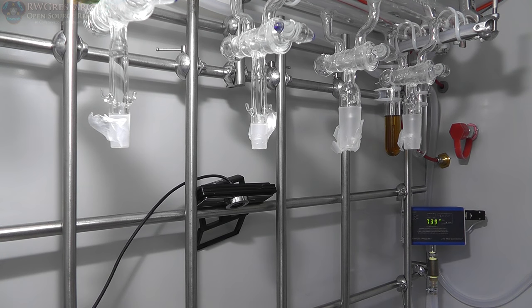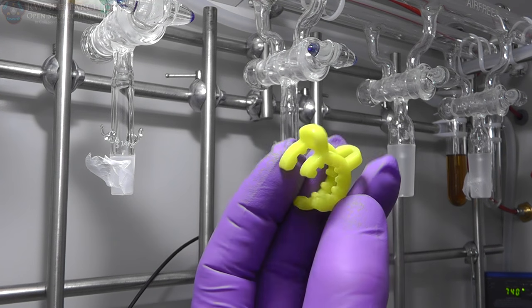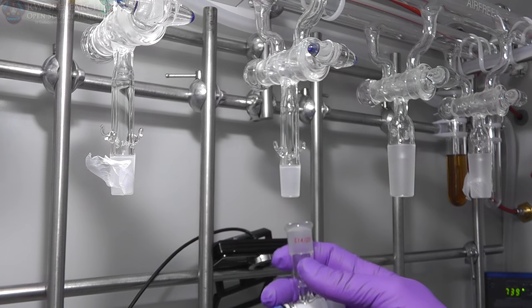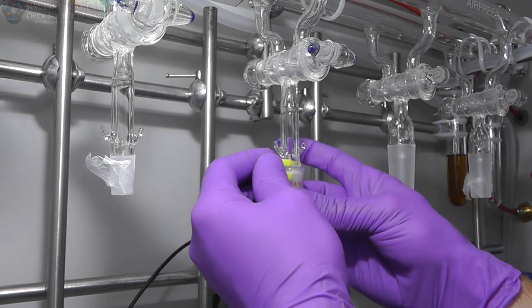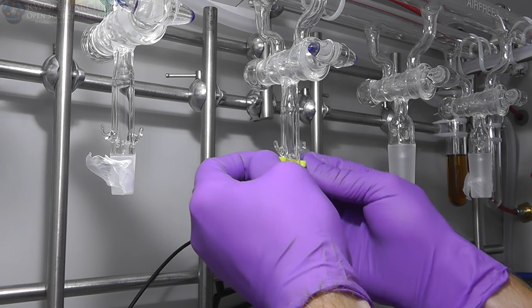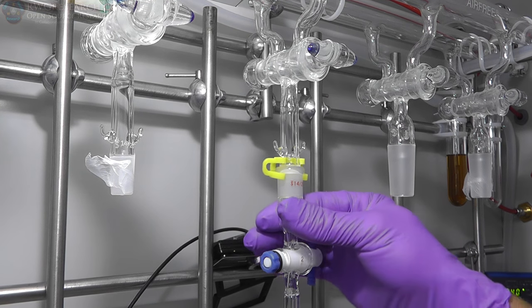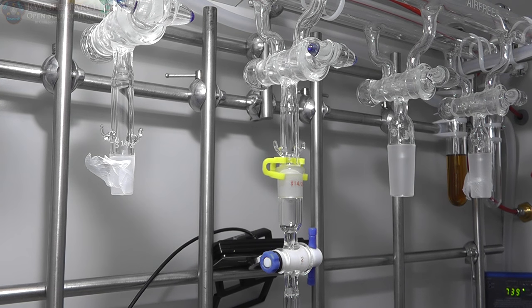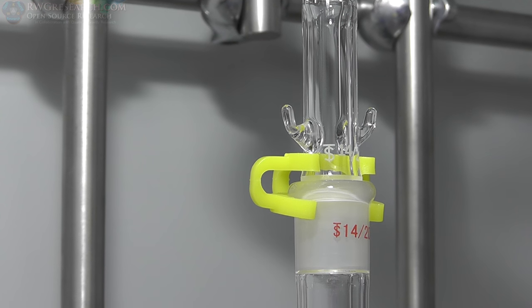Well, let's kind of put one of these on, shall we? Alright, so let's talk about these clips. So this is a small plastic clip, and it actually holds these components together when you get them assembled. So I'm not going to put grease on this, I'm just going to demonstrate so you can see. Pop this guy on here. Very gently pop that guy on there. And now this holds this in place, so that way you don't have to worry about them falling apart. If there's a pressure or something like that, even if it gives, at least it won't completely fall down and bust. So anyway, that's how that works. Pretty simple.